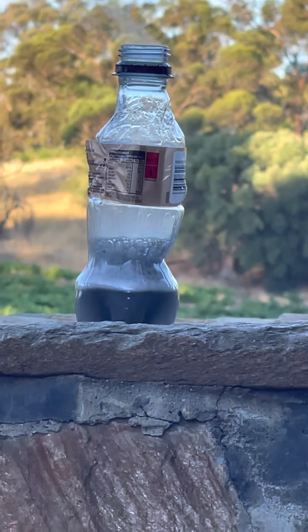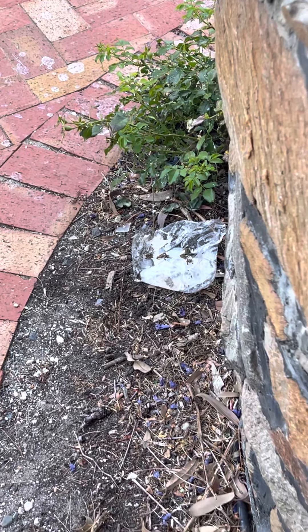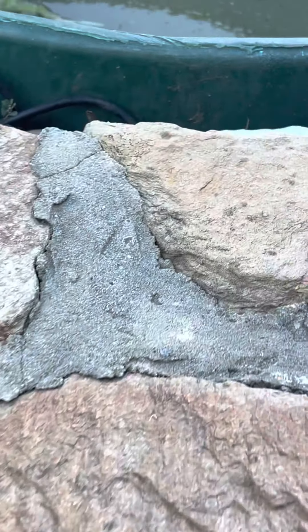That reaction is extremely violent, the hydrogen gas is nasty stuff. And before it tips over, I'm afraid I'll have to end this reaction — it's getting out of hand. I'm not going to kick it or anything like that because that's going to get it all spilled. I'm going to grab a stick. Look at how badly mangled the bottle is. This is boiling hot — don't breathe in the fumes, they are not good for you. What I will do is grab the bottle, tilt it up, and then release this entire bottle inside of the water to cool it down a little bit, and press the bottle so it gets into the water.